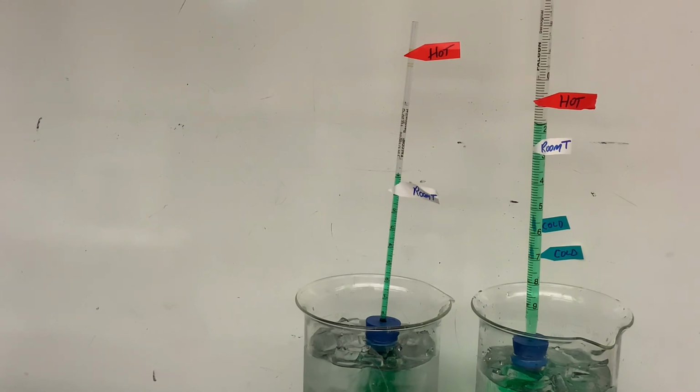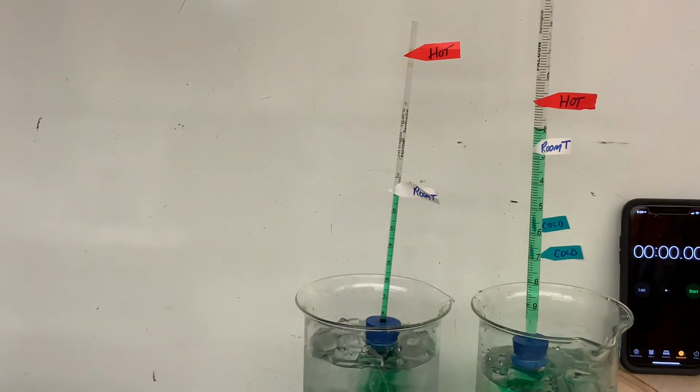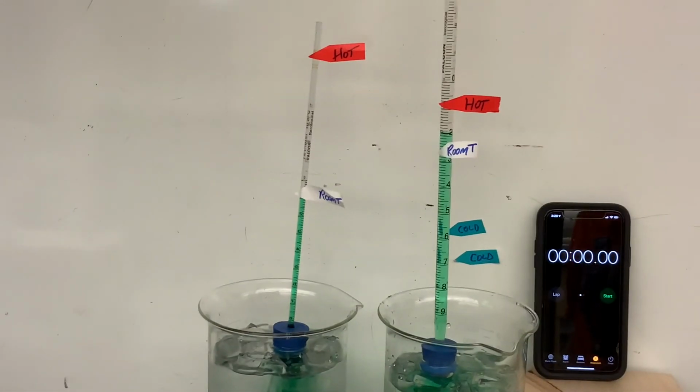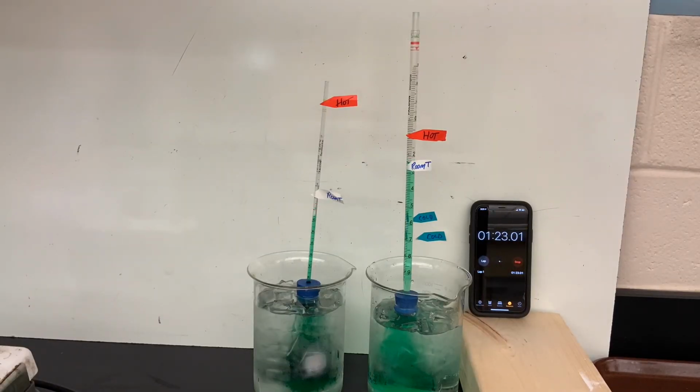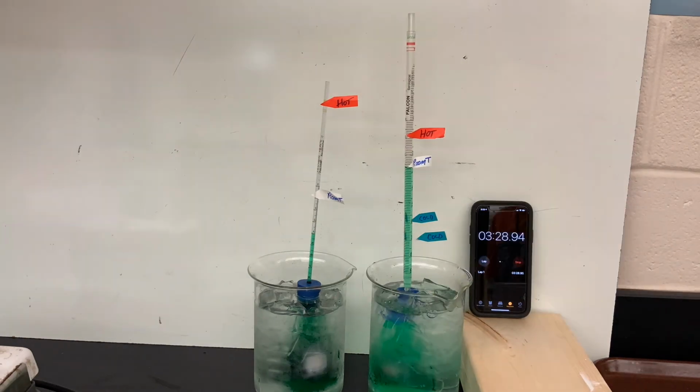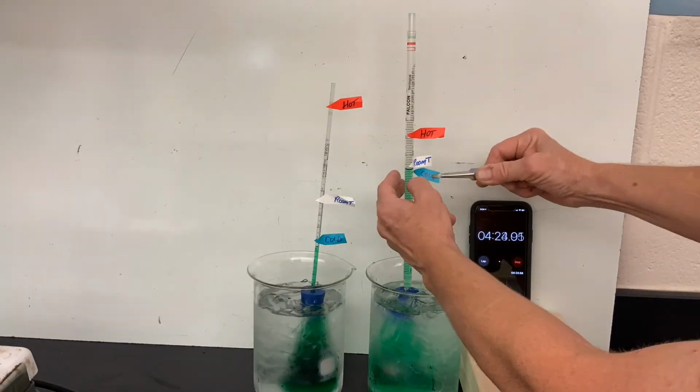When we finish, be sure and mark all of the levels on your diagram in the lab sheet. And now you can see I'll add the phone so that you can see how much time actually did lapse, and then at the end you can stop the video and make your 3 markings on your lab sheet and move on to completing the lab.